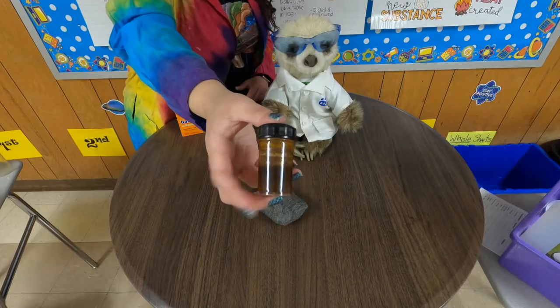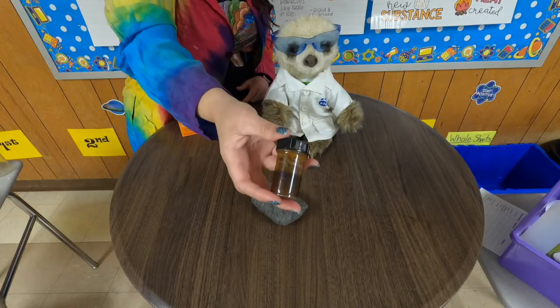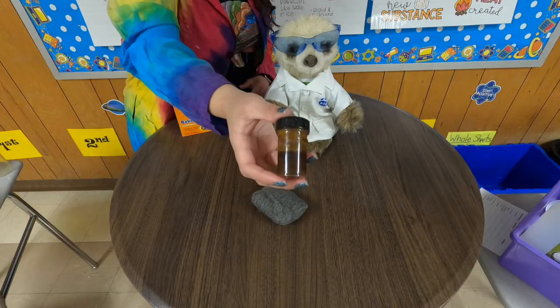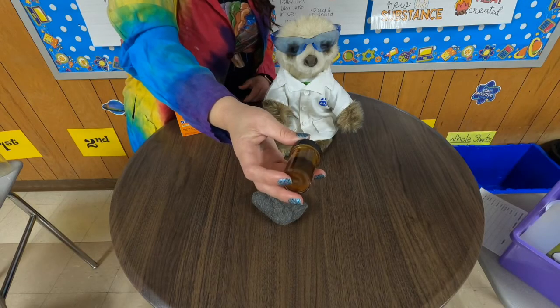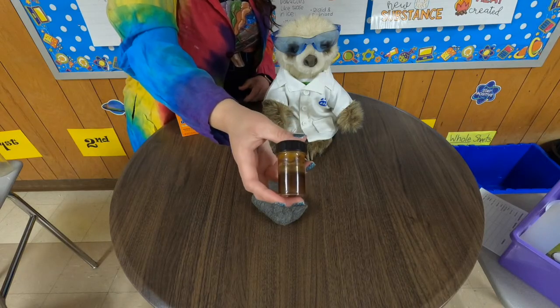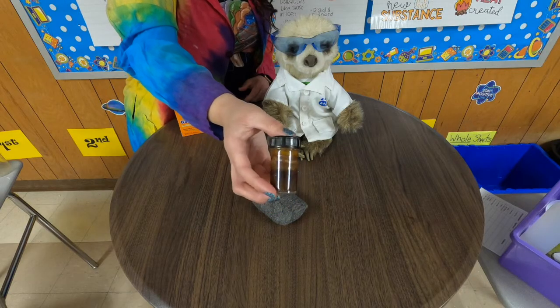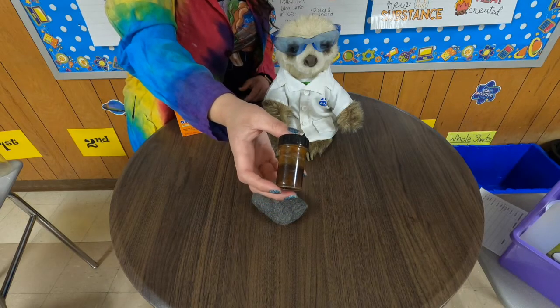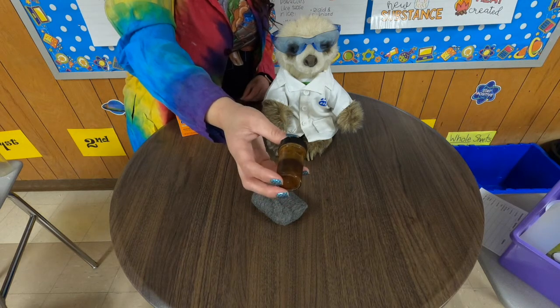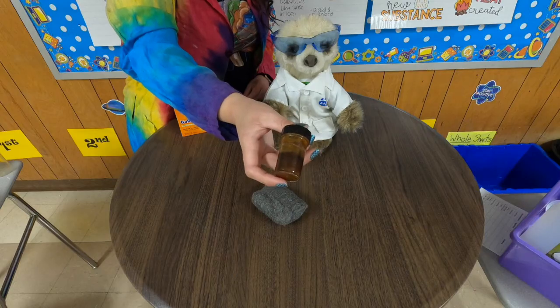And what is your evidence for this? This is actually a chemical change. We know that it is a chemical change. Rusting is always a chemical change, but why? The reason that rusting is a chemical change is an unexpected color change. It is a reaction. A new substance is being formed. The atoms are being rearranged. The reaction is called oxidation. And that's what makes it turn red.